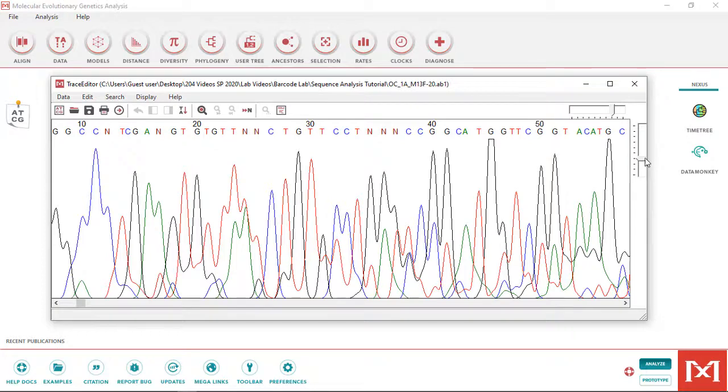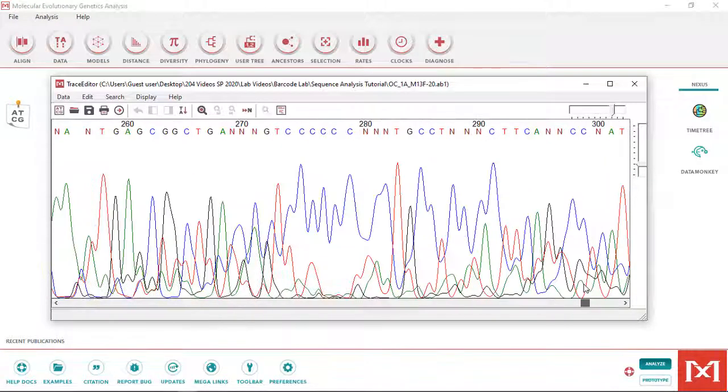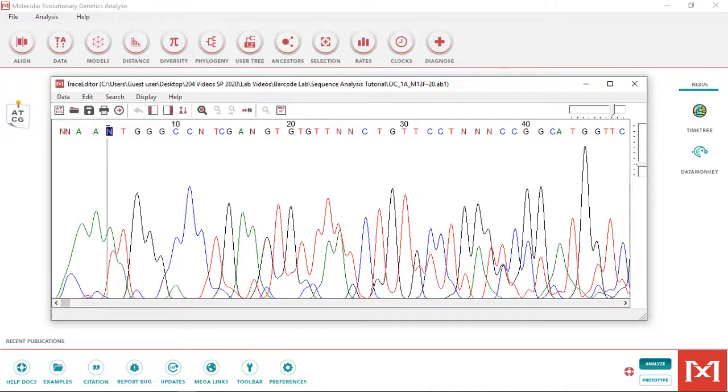You'll notice that each nucleotide call is associated with a different color. T's are red, C's are blue, G's are black, and A's are green. Notice also that here at the beginning and at the end of the sequence, and possibly scattered here and there throughout depending on the quality of the sequence data, there are N's. These represent uncalled nucleotides that didn't meet the quality threshold for the algorithm to make a confident nucleotide call.